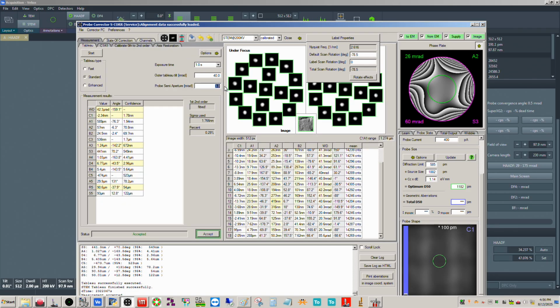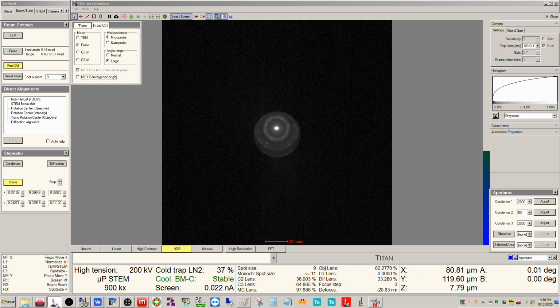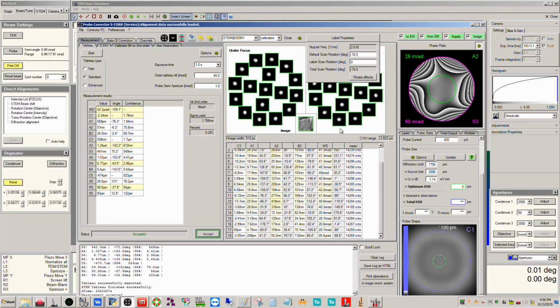If we wanted to estimate this, if we come over here, our probe semi-angle is 1 millirad, and our probe current, I believe, is about 22 picoamps. It's saying our probe size is about 1.5 nanometers. So keep that in mind when you're doing this. That's kind of what we're working with here.